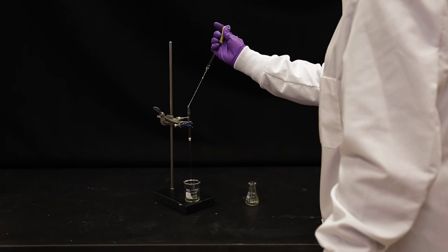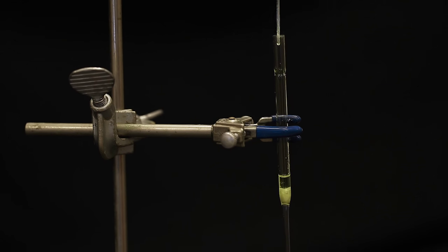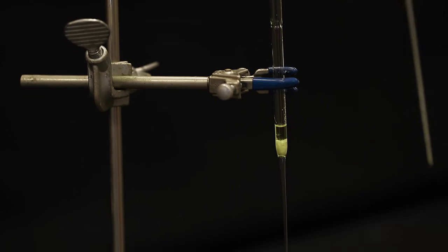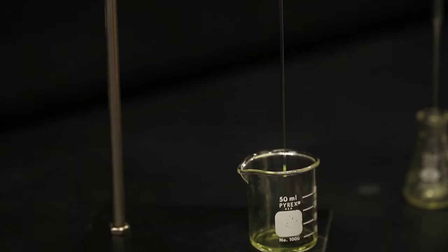This technique video demonstrates using Pasteur pipettes for filtration, which aids in the removal of impurities from a liquid when working with small amounts.